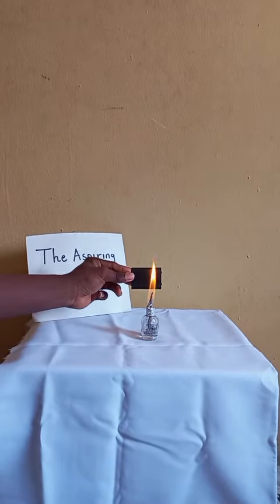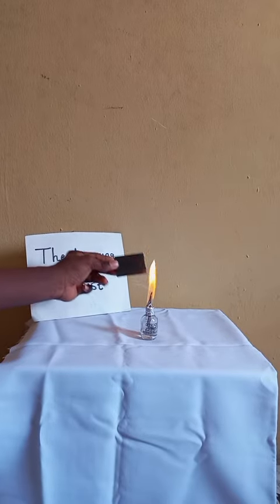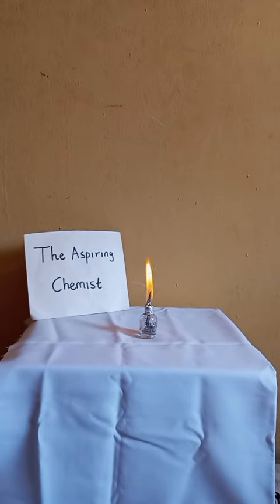See? To guarantee that it works, I've already used this in some of my other videos, and in my upcoming videos, I will show you when I use it.